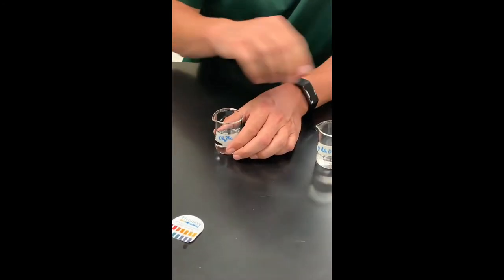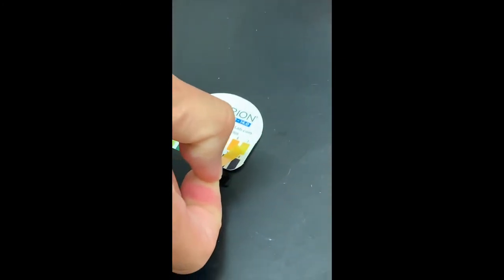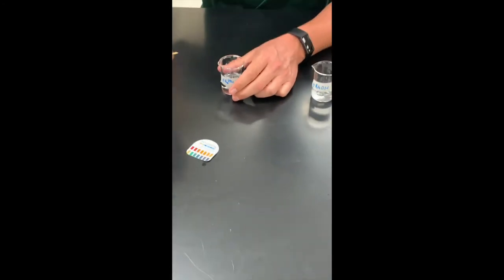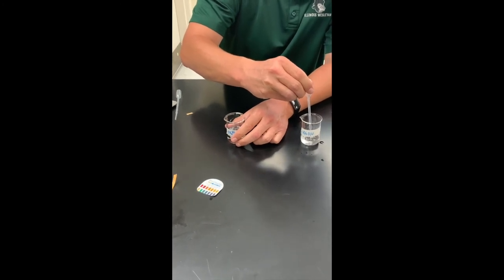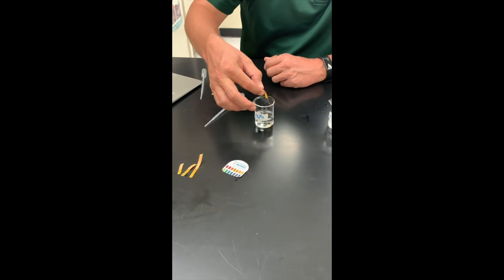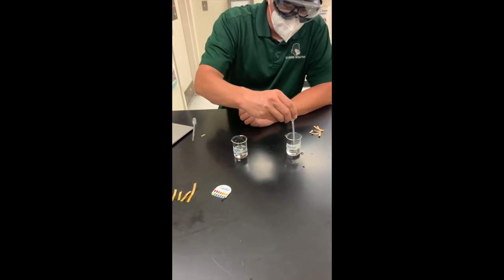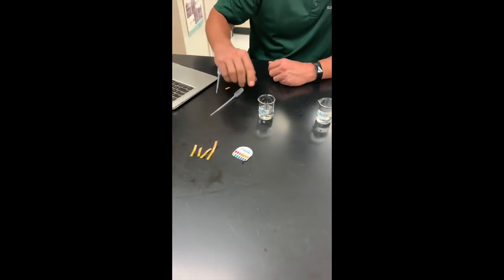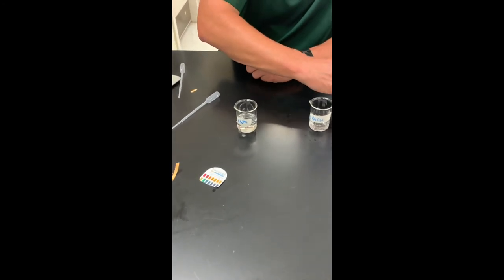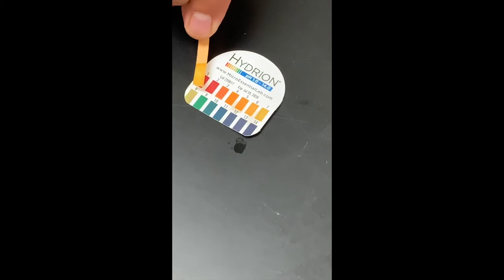That was our first milliliter. Second milliliter added — check — still sitting at about a seven. Third milliliter — check — still looks like a seven. After three milliliters of sodium hydroxide, here is our fourth milliliter — added, swirl, check — still looks to be at a seven. I don't think that's an eight yet. That's a seven.